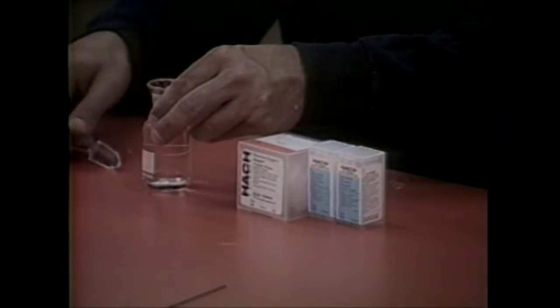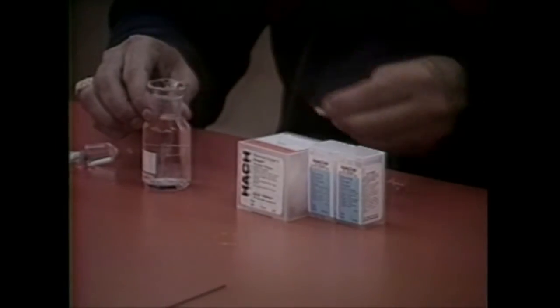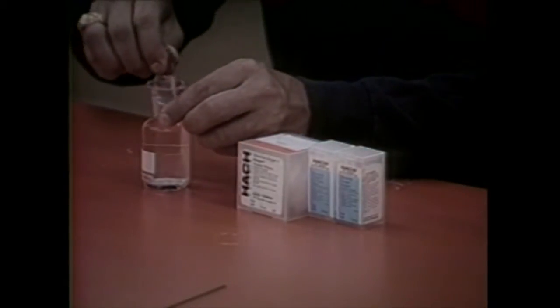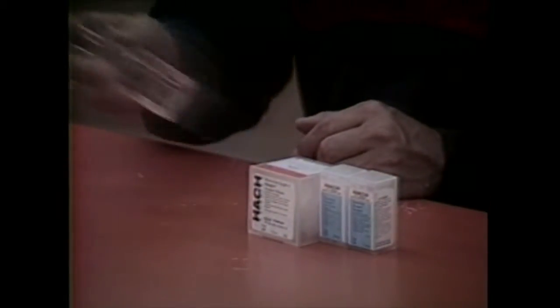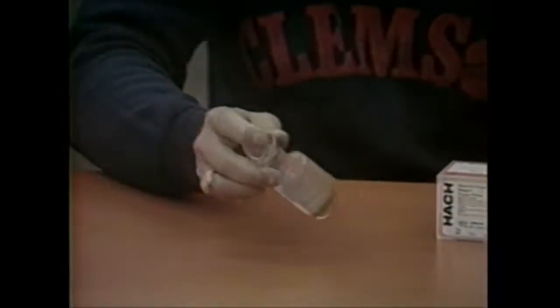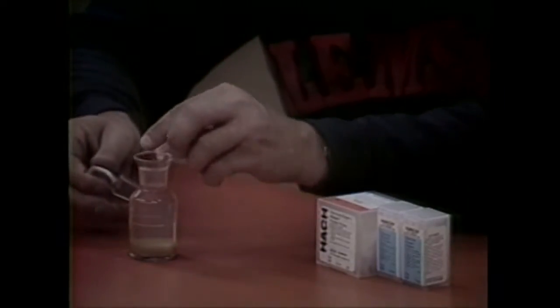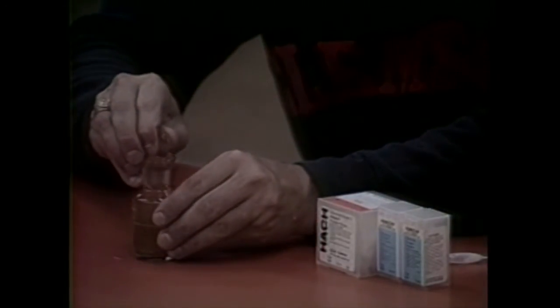Carefully remove the stopper from the bottle. Add the contents of one dissolved oxygen reagent 1 powder pillow and one dissolved oxygen reagent 2 powder pillow to the bottle. Stopper the bottle firmly to avoid trapping air. If air bubbles are present, discard and obtain a new sample. Shake the bottle vigorously for a few seconds to mix. A floc will form which will be brownish orange if oxygen is present. Allow the sample to stand undisturbed until the floc has settled to the lower half of the bottle, then shake the bottle again and allow the floc to resettle a second time below the line on the bottle. Remove the stopper and add one dissolved oxygen reagent 3 powder pillow. Re-stopper and shake several seconds to mix. If air bubbles result, obtain a new sample and start over. After shaking, the floc will dissolve and a yellow color will develop if oxygen is present. This is now referred to as a prepared sample.